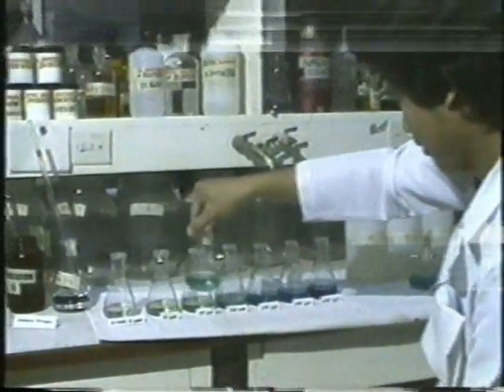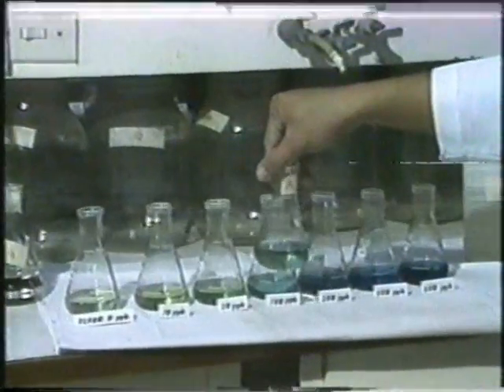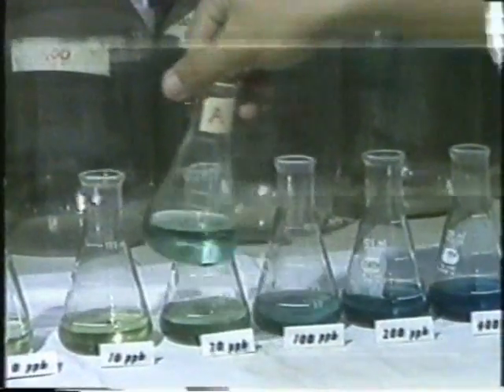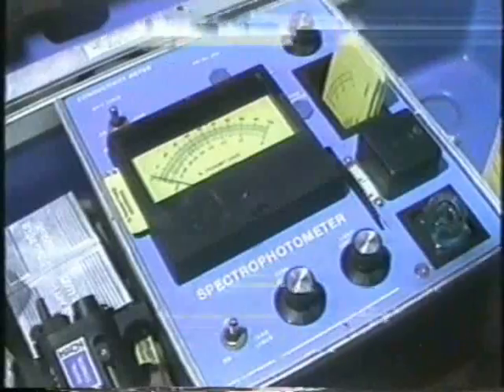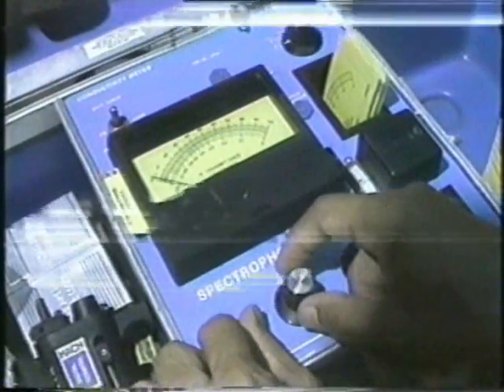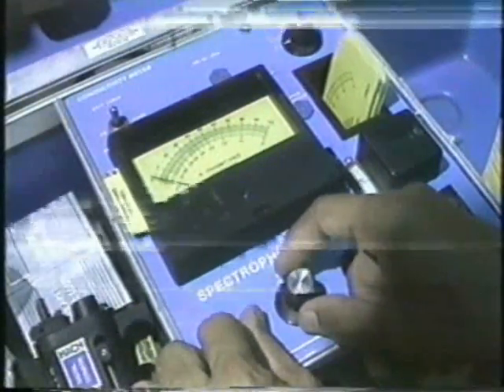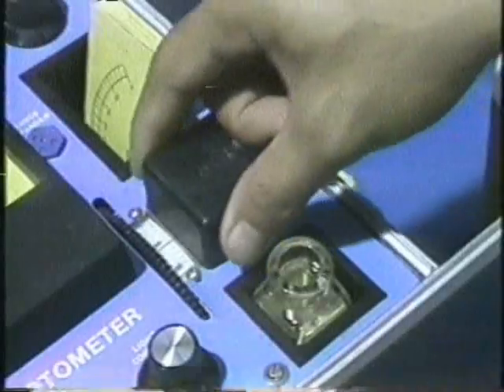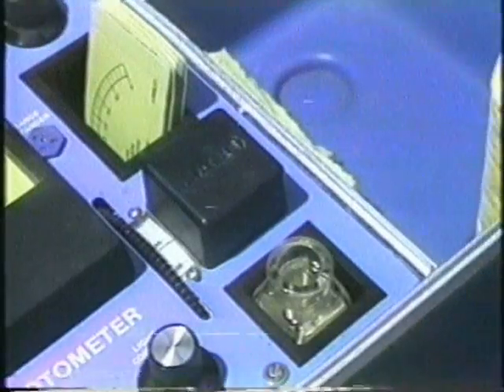By visual inspection, we can estimate the amount of ammonia nitrogen our samples contain by comparing them with the standard dilutions. The colorimeter eliminates guesswork because it can tell us exactly how blue the standards and samples are in comparison with pure distilled water treated similarly with chemicals.